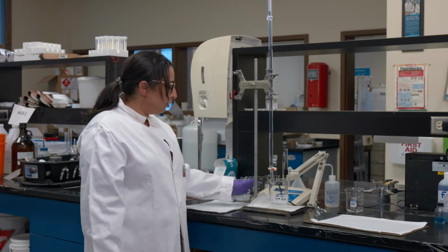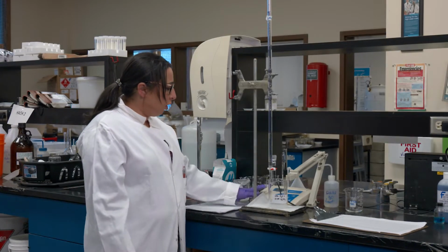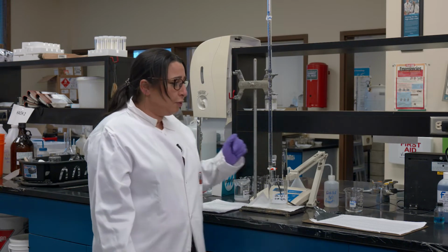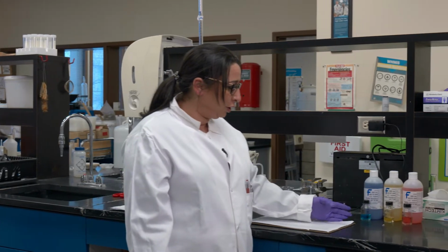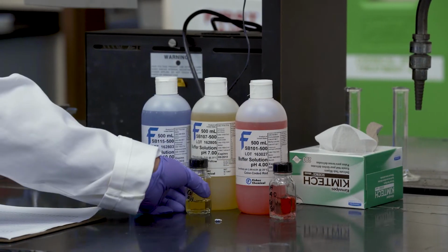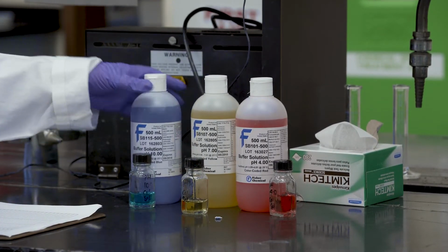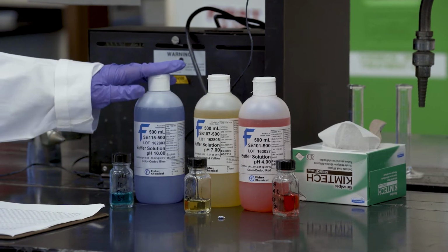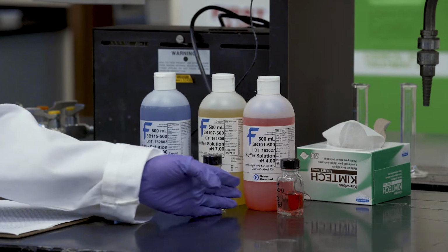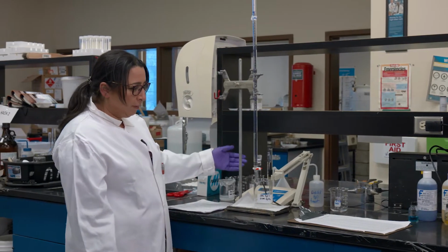A little introduction on the pH meter, because I'm not going to calibrate it in front of you. I have already calibrated this pH meter using a 3-point calibration, which means I used 3 buffer solutions: starting from the acidic one, which is pH 4, then the neutral one, pH 7, the yellow solution, and then the basic one, pH 10. You have seen these already, but this is just a quick introduction to what is involved in the pH meter. I have calibrated it already.